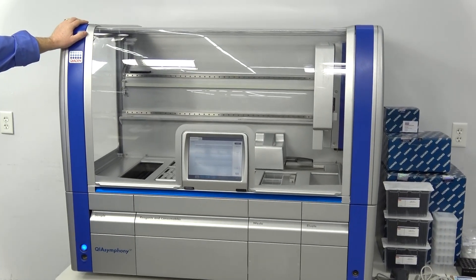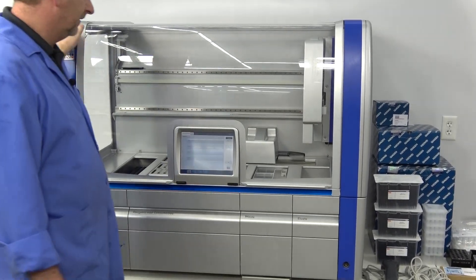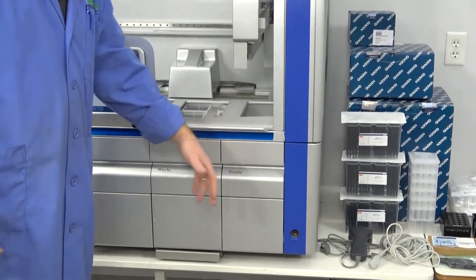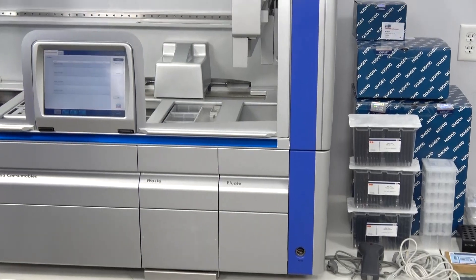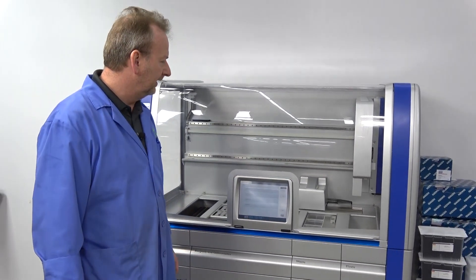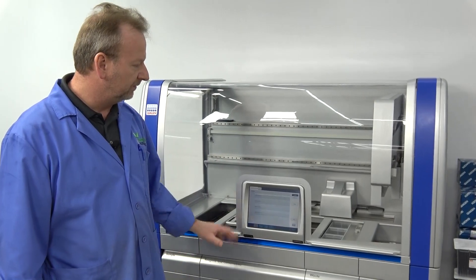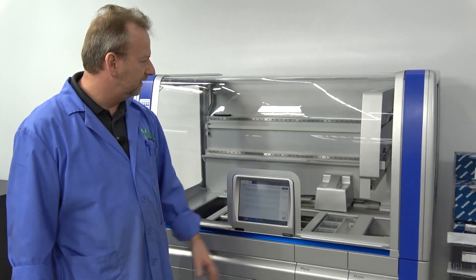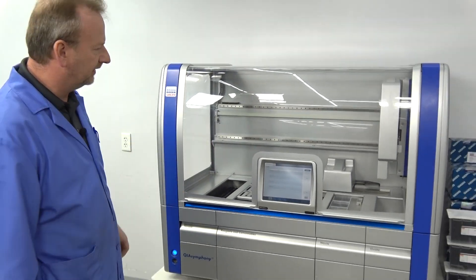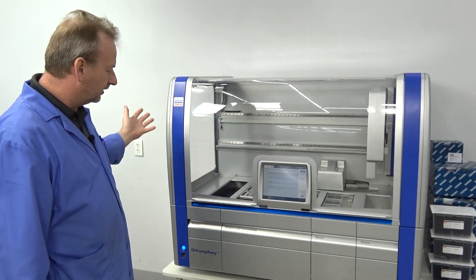We did a little bit of work to it. When we got it in and initialized it, I was getting an error. After getting into the drawer and pulling out the board, I found a component that needed to be replaced — a very simple procedure. It was just a really small transformer that wasn't working, but we replaced that and put it all back in. Now it's working great, and I think it was probably just from shipping — that component probably just jostled enough to cause the error. So it's working great now.